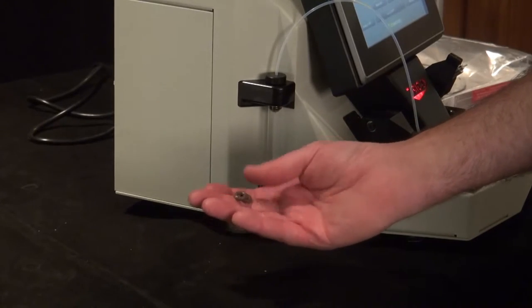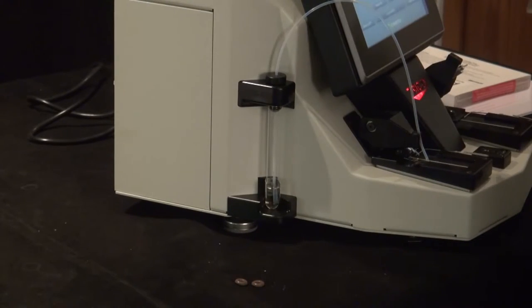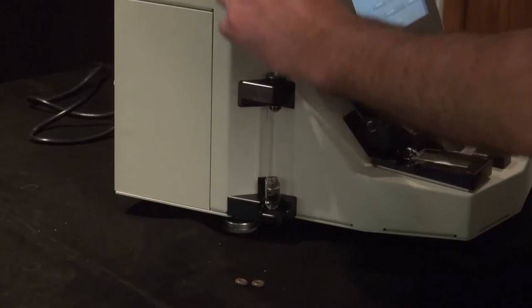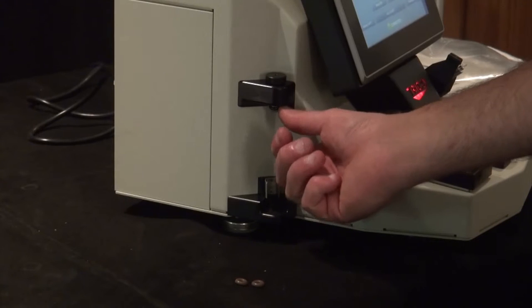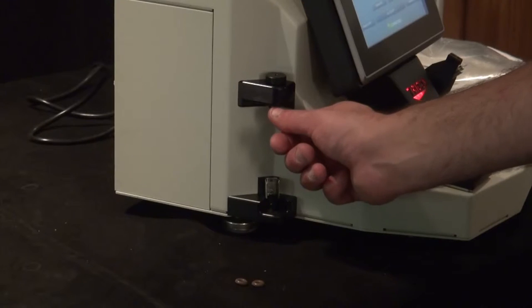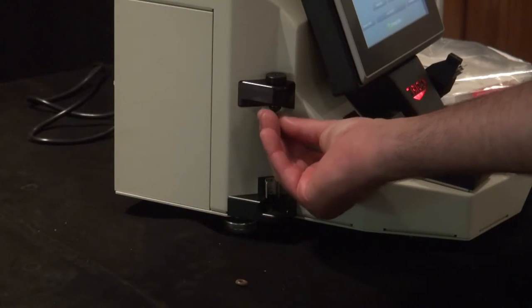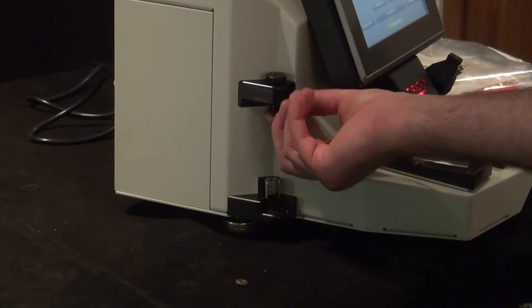You're going to grab the two large O-rings, and they're Viton. And then there's two small tiny O-rings inside your parts kit that you want to grab out of there. So you're going to take your tube out, take your sample off, and cut this O-ring off of the nipple on the bottom. You'll take a little razor blade and cut it off, throw it away, and then put this one on. What you're going to do is start from the back, get it started, and then it takes a little bit of effort, but you can get it back on there.